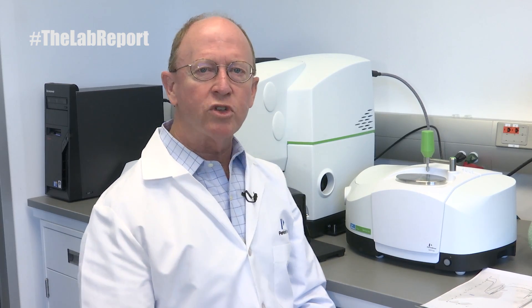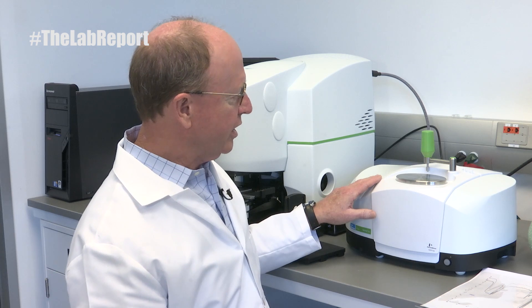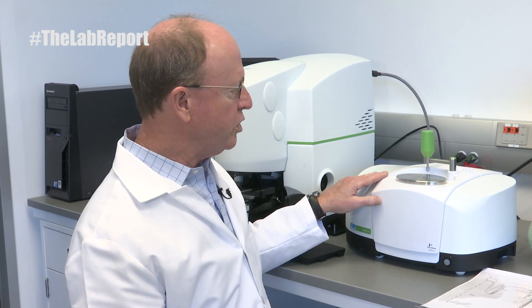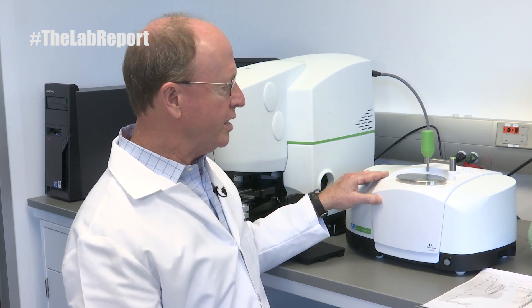That's why FTIR is so valuable — because it allows a user to identify a compound based on this fingerprint or unique spectrum. Let me introduce the Spectrum 2 FTIR configured with the Universal ATR, or UATR.